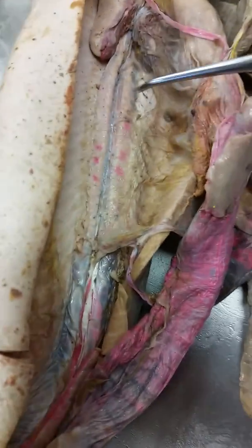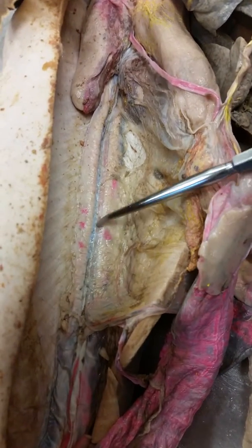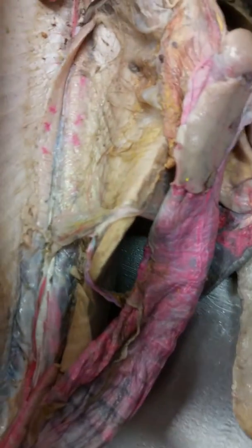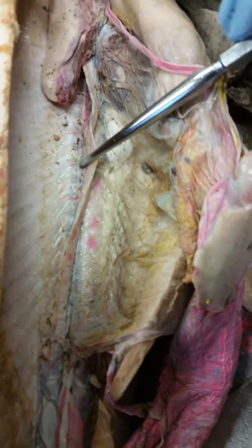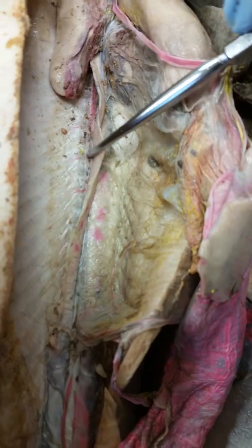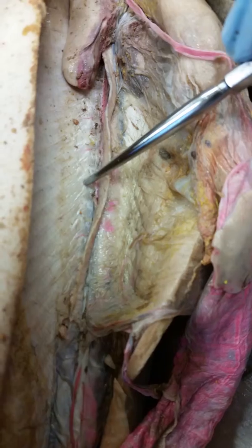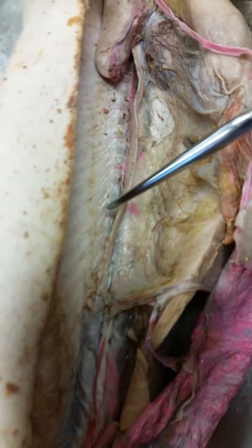This is the dorsal wall of this shark. The intersegmental arteries are the little pink arteries right there — they come off the dorsal artery, so these little pink guys right here.